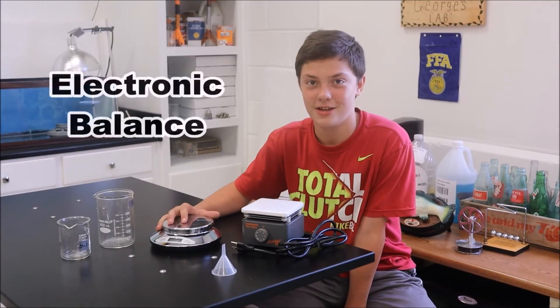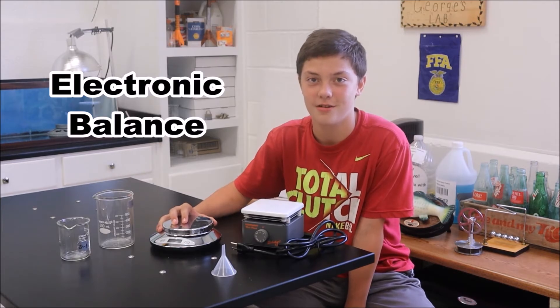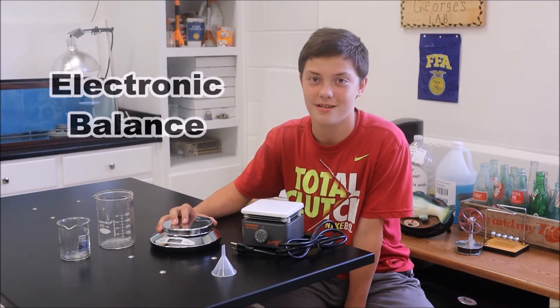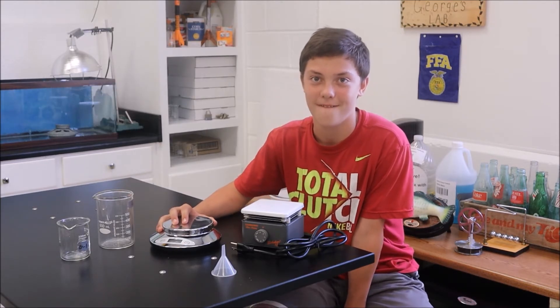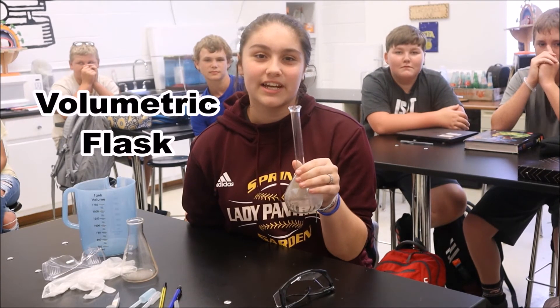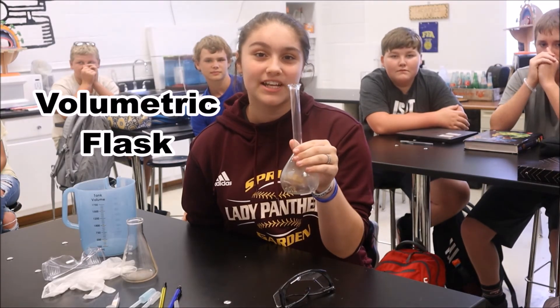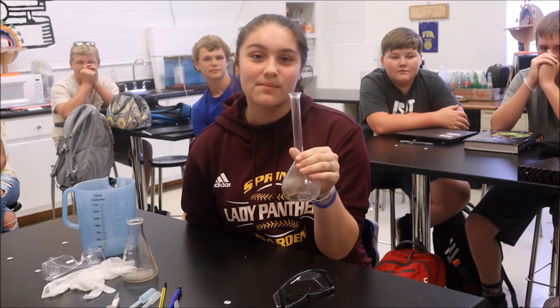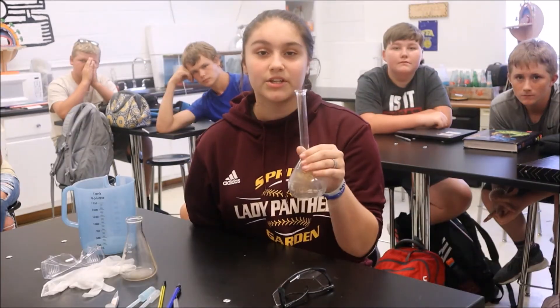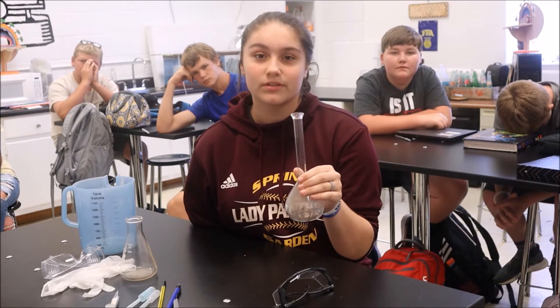This is an electronic balance and it's used for measuring mass in the lab. This is a volumetric flask. It is a round flask with a flat bottom. It is used for the preparation and measurement of solutions.